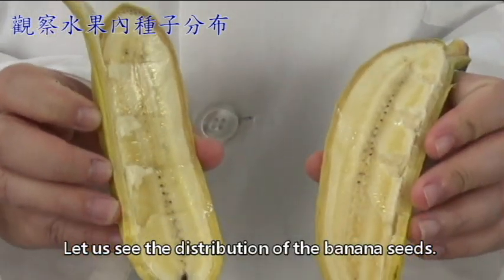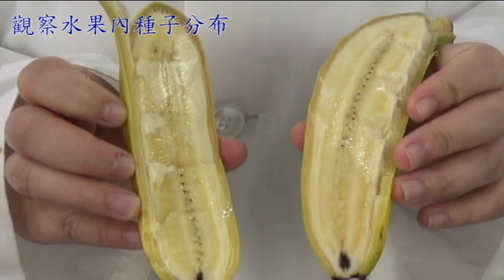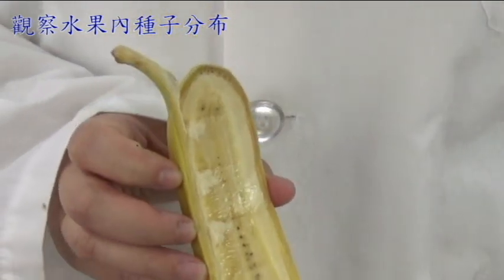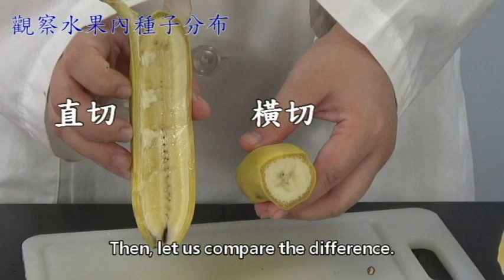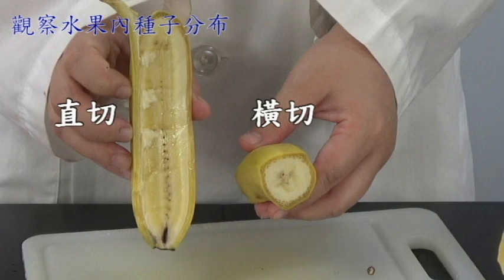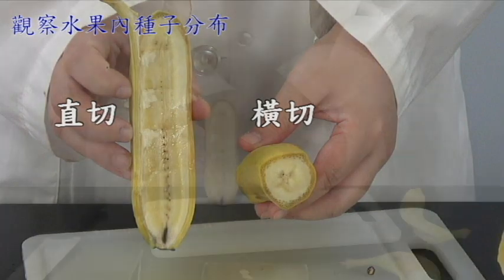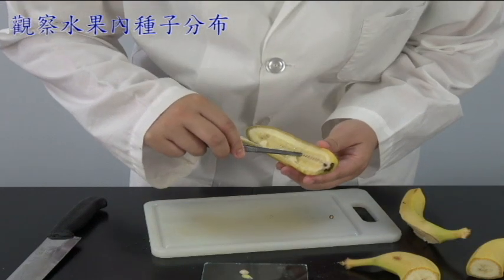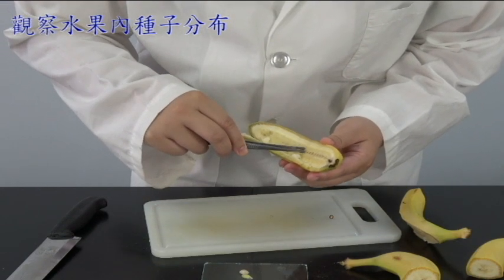Let us see the distribution of the banana seeds. Then, let us compare the difference. We take the seeds out.